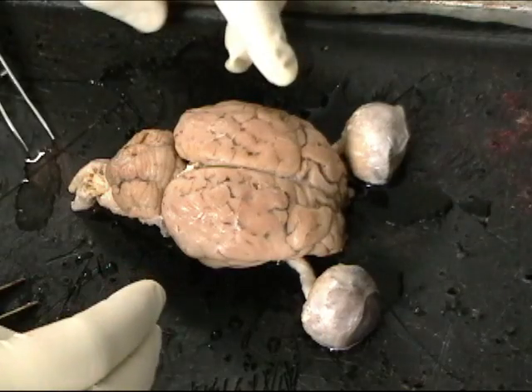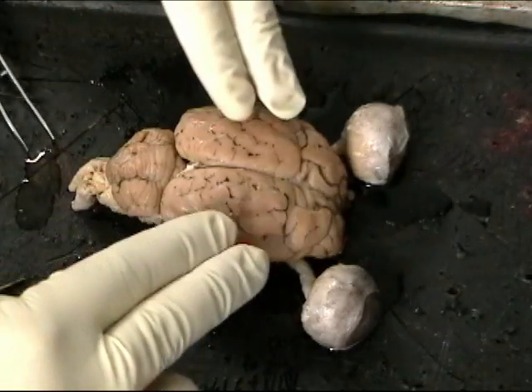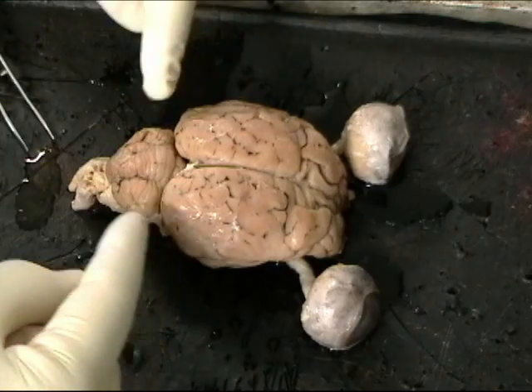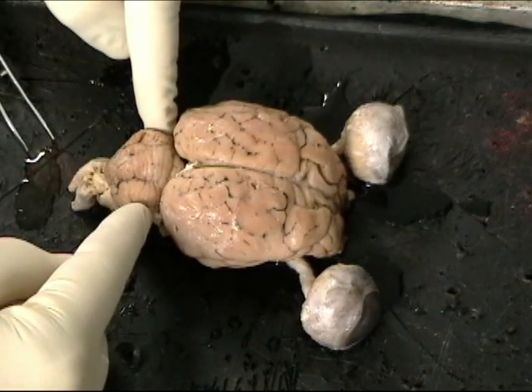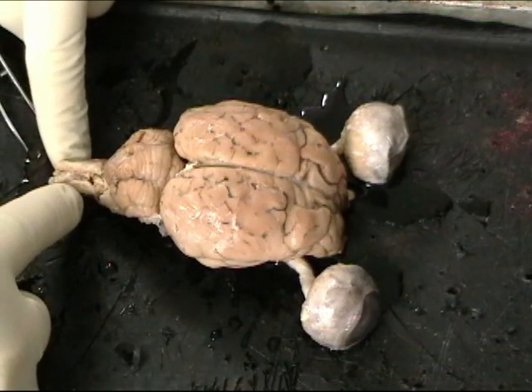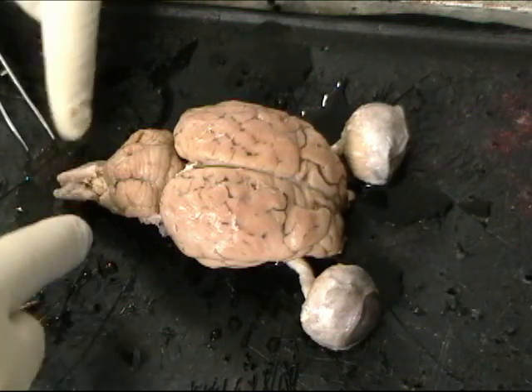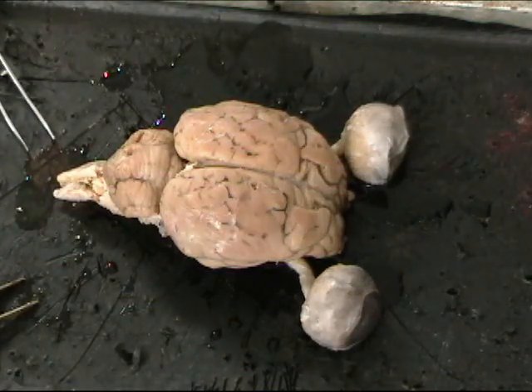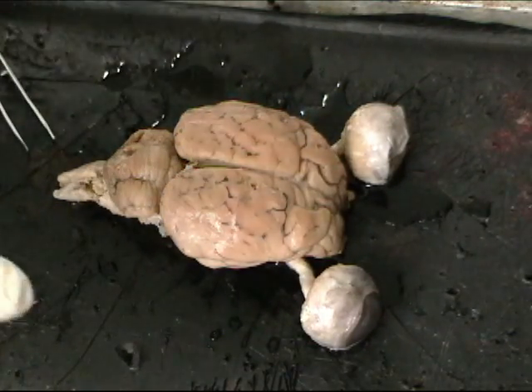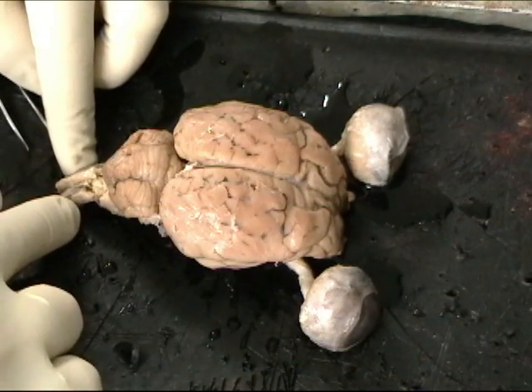Looking down, you'll see two hemispheres. This would be the cerebrum, and the outer surface would be the cerebral cortex. Behind the cerebrum would be the cerebellum, and then the most posterior part down here would be the spinal cord. So the spinal cord would be carrying axons carrying sensory information from our senses in our body, for example, and also axons from motor neurons leading out to muscles to move our body. In addition, pain fibers and other kinds of sensory neurons.